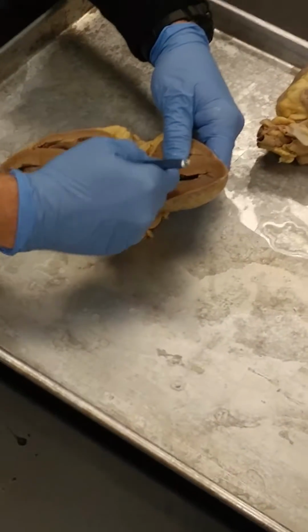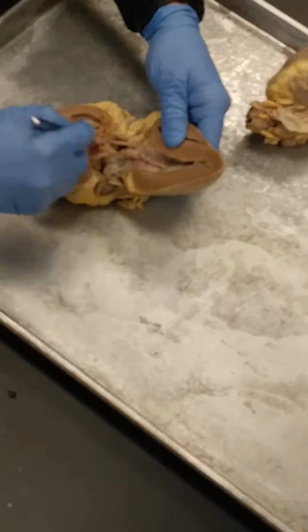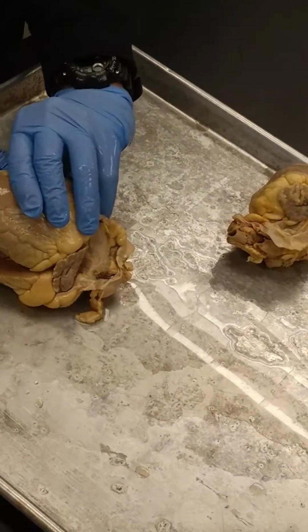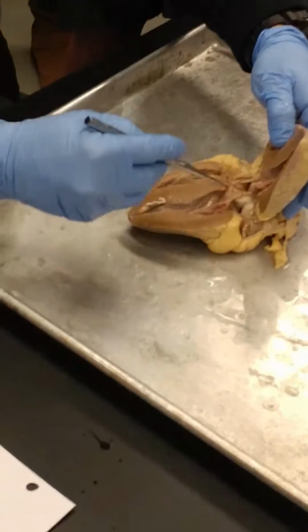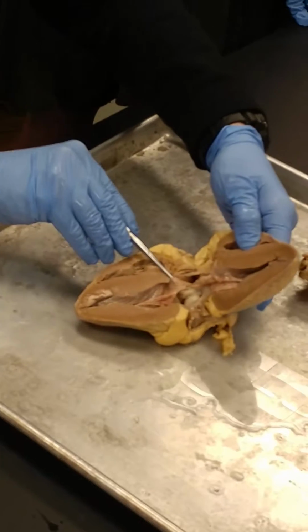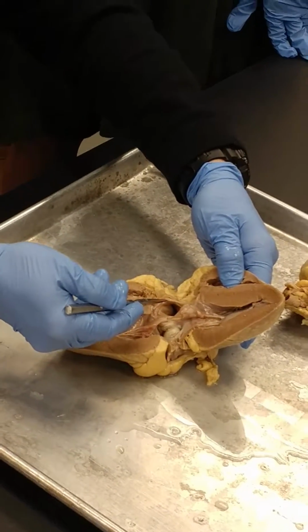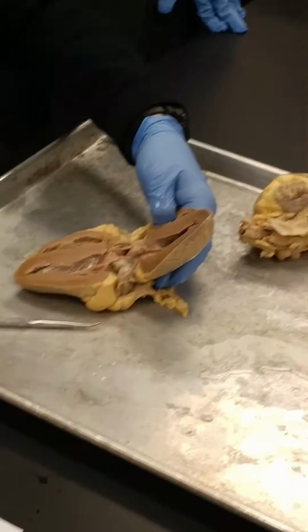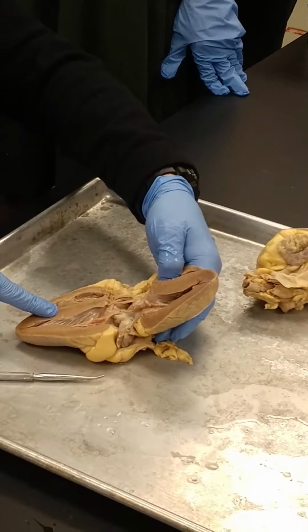There are 3 of these pockets. This one's been cut. This one's still intact. That's one valve cusp. And then this is the other one on the other side. Remember when I fold it back down together? Those 3 pockets come together to catch the blood and close. So there's one valve cusp, there's another valve cusp, and this is the 3rd one that's been cut. All right? Interventricular septum, we talked about that.